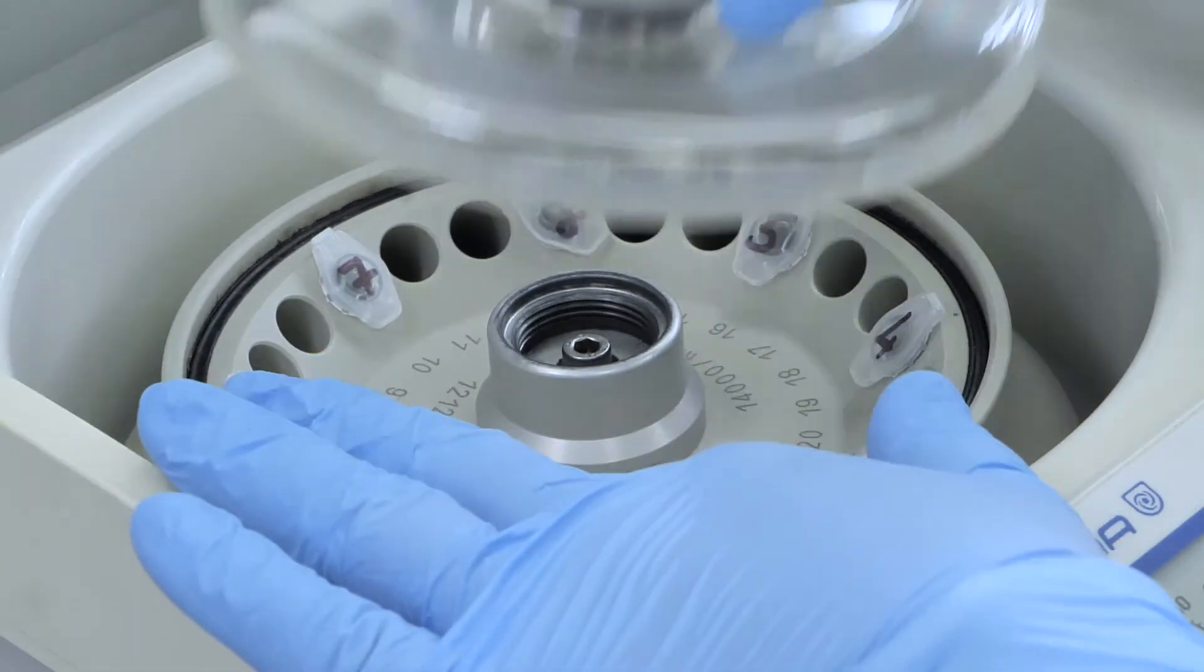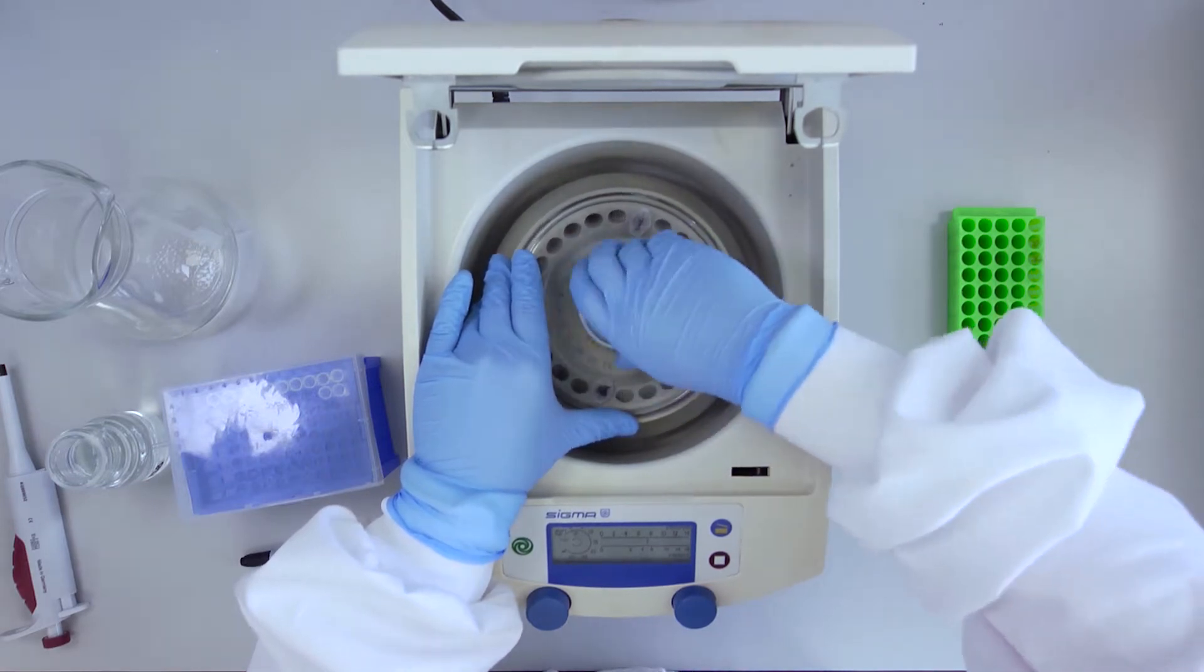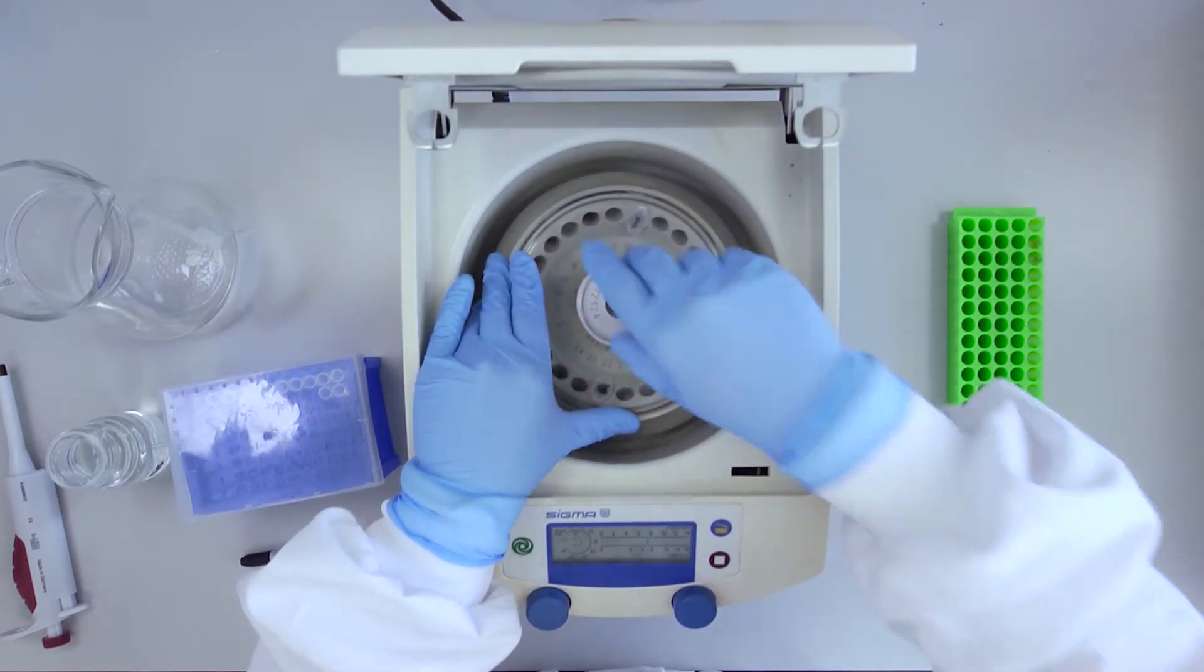Once loading is complete, attach the internal cover and press down on the lid.